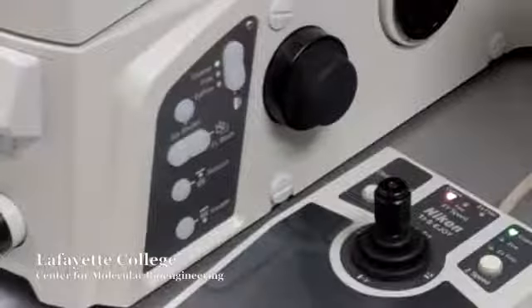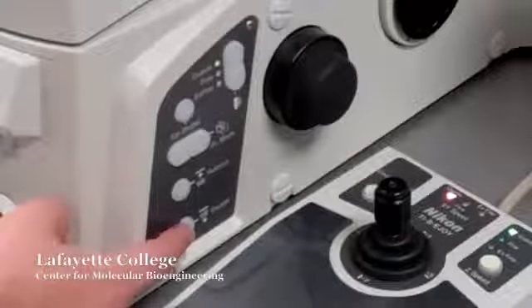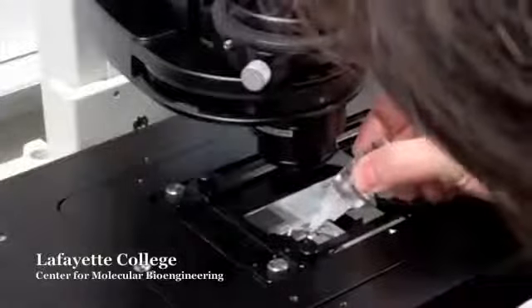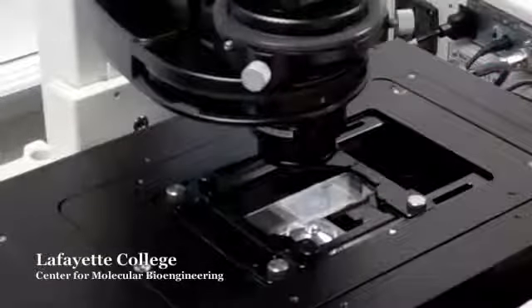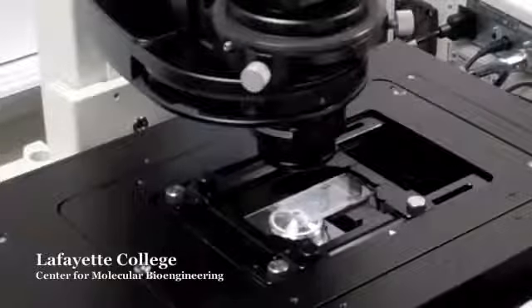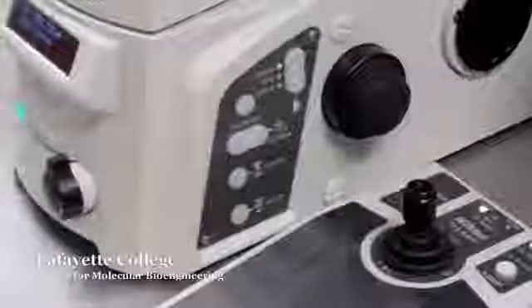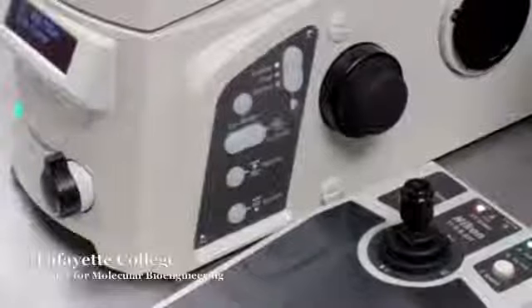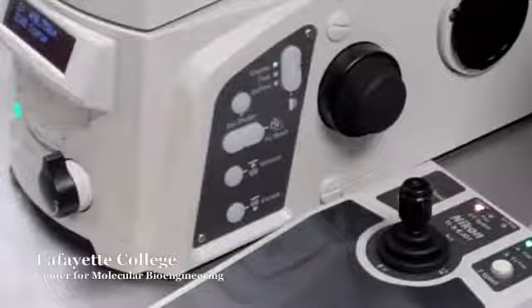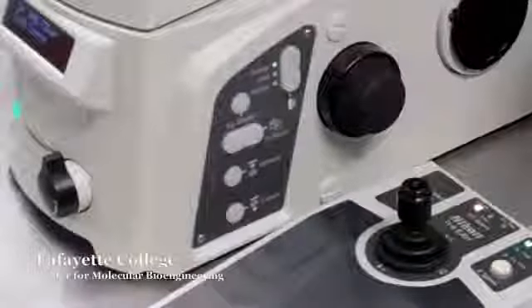To change between 10x, 20x, and 60x objectives, first press Escape to lower the nose piece. You can manually select your objective by using the rotator beneath the stage. If using the 60x objective, be sure to add a small drop of oil to the objective's nose piece before refocusing. Once you have finished selecting your objective, press Refocus on the right side of the microscope to raise the nose piece back to the desired location.